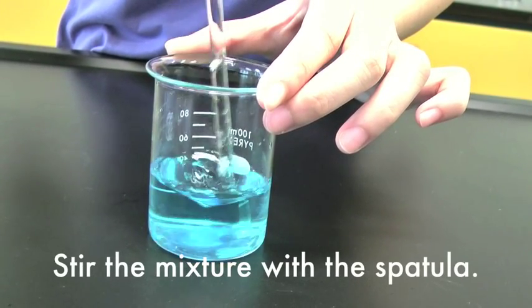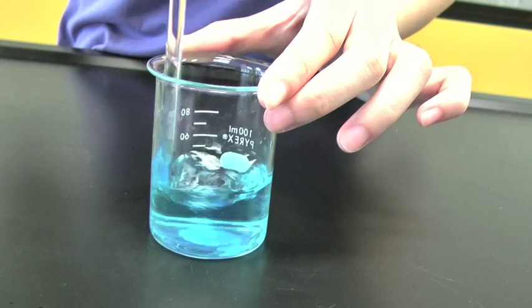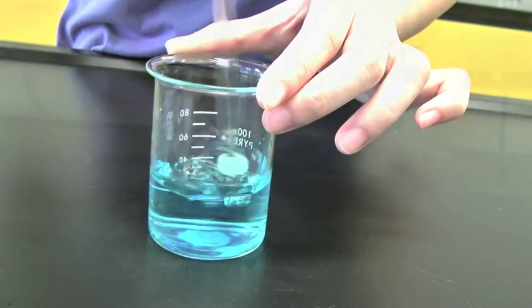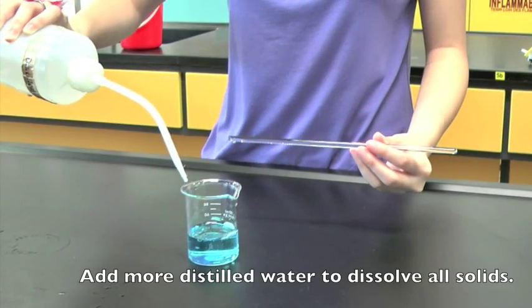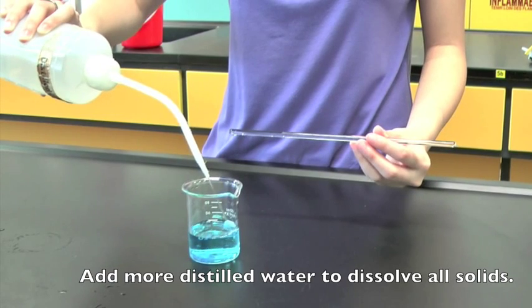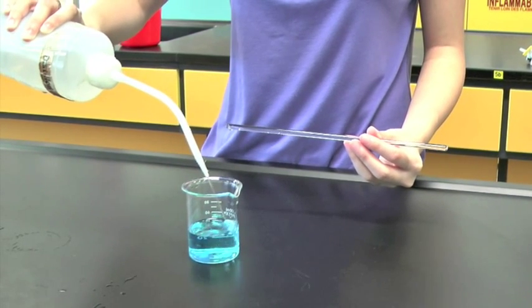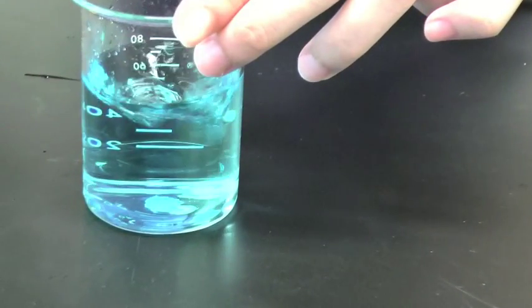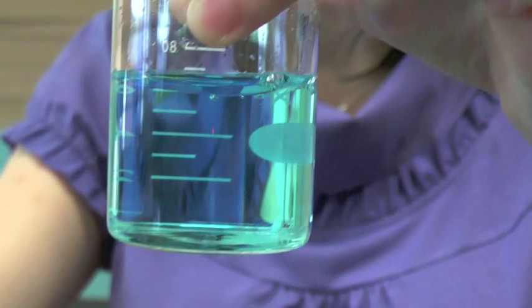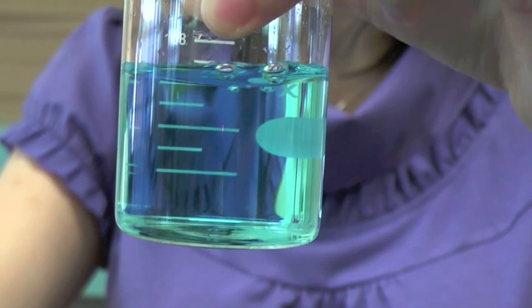Stir the mixture with the spatula. Add more distilled water to dissolve all solids. Continue to stir the mixture until a clear solution is obtained.